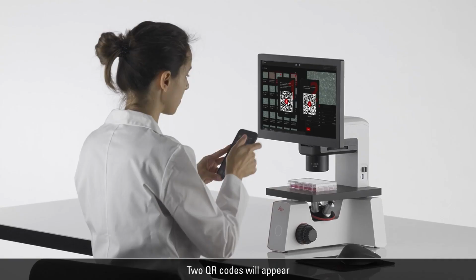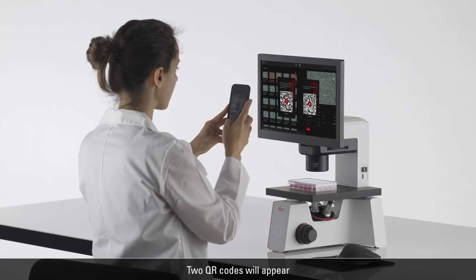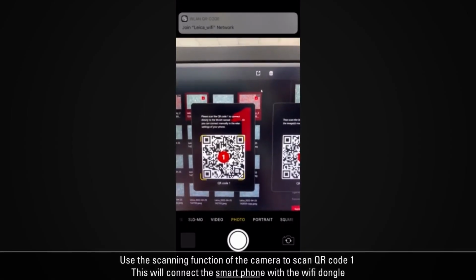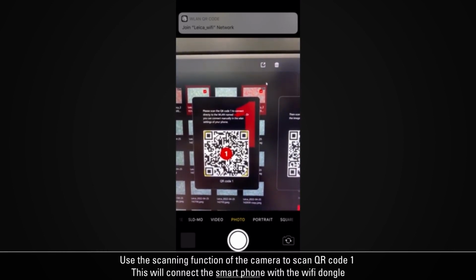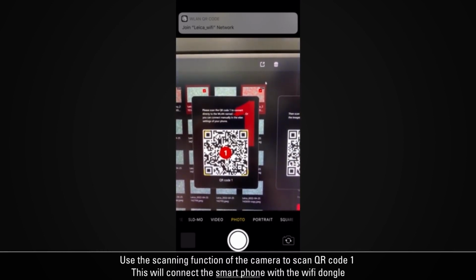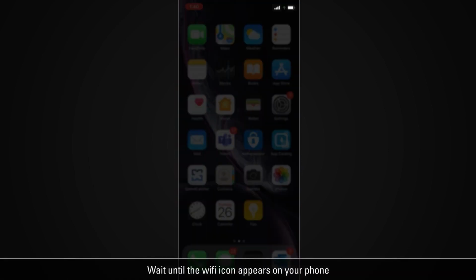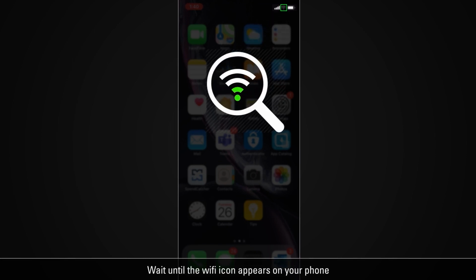2 QR codes will appear. Use the scanning function of the camera to scan QR code number 1. This will connect the smartphone with the Wi-Fi dongle. Click Join. Wait until the Wi-Fi icon appears on your phone.